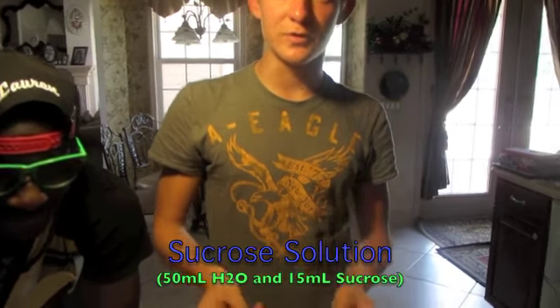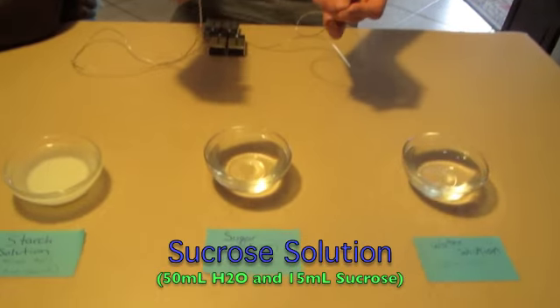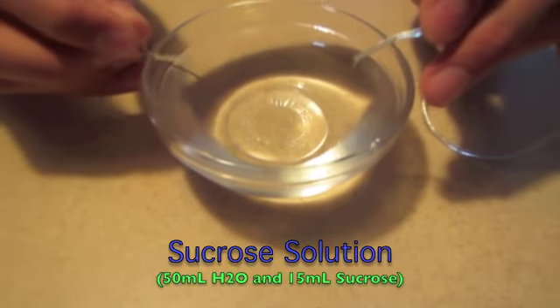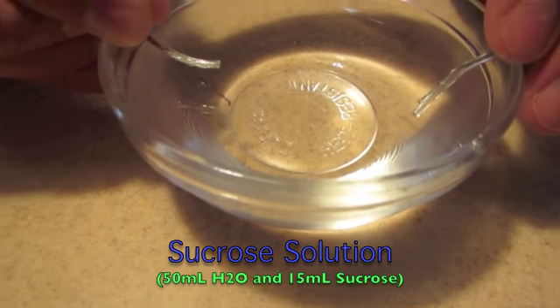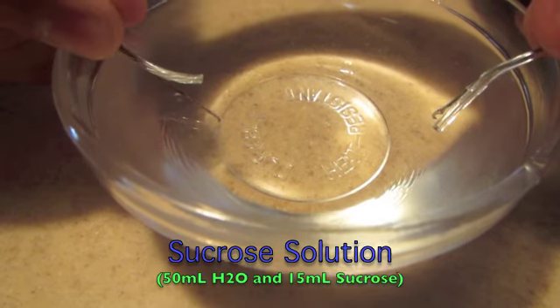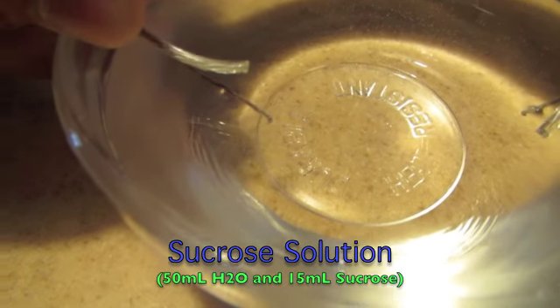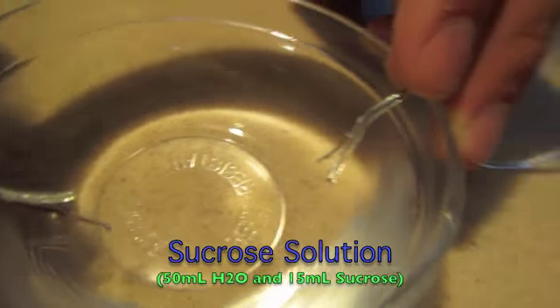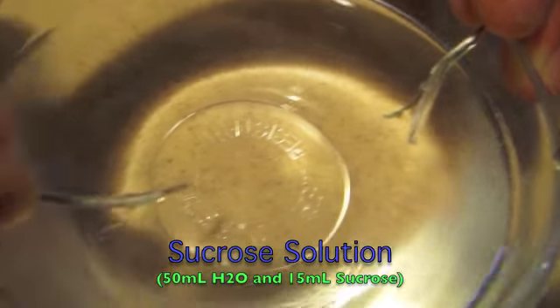This sugar solution is also a covalent solution, and since it's covalent, it should produce pretty much the same amount of bubbles as water. Because you see, as the electricity runs through it, it'll start forming bubbles on the copper wire, because it's splitting the water into hydrogen and oxygen. See that right there?